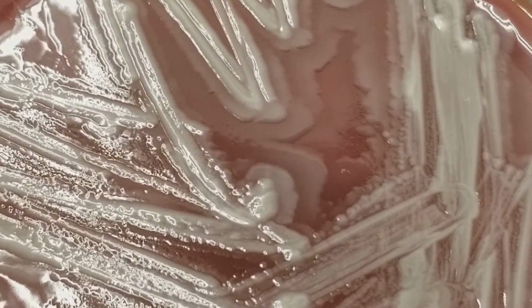Okay, and normal flora in a place where it's not supposed to be ends up being a pathogen, and if it is a pathogen, usually they don't always swarm. I just like this plate. They take over the plate in regard to it's the most prominent growth that would be on the plate, and those would be the types of things that you need to work up.